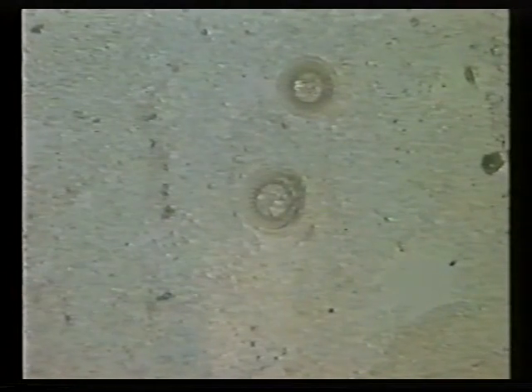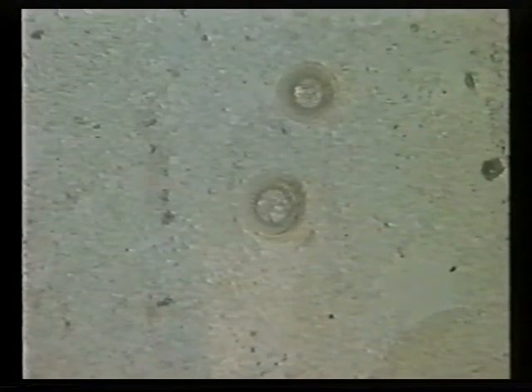Also, you need to find the correct way to systematically view your slide. The best method is to first search the periphery of the sample. Parasites can be more readily observed in the clear fluid area, especially smaller parasites like Costia. Next, proceed by scanning from side to side, moving down 1 pitch at a time so you cover the whole slide. This process can take quite a while to complete correctly.